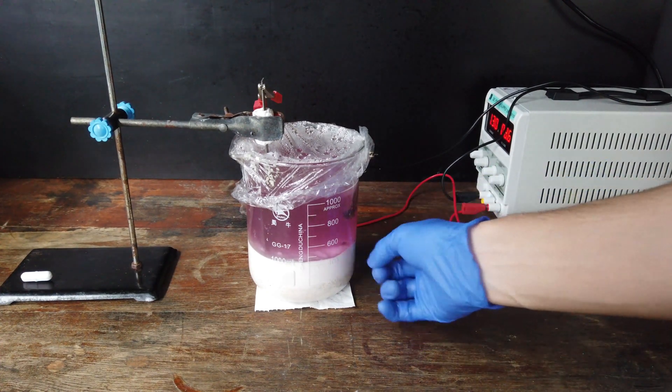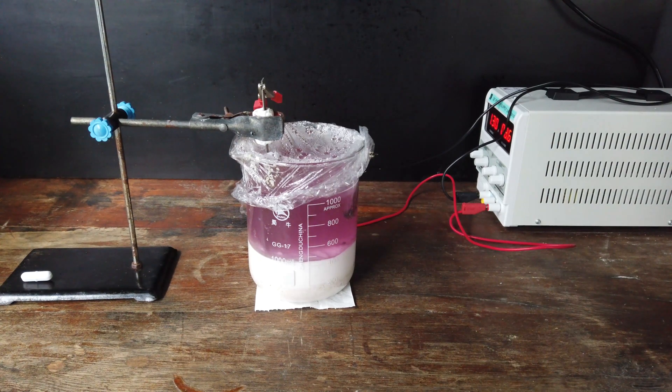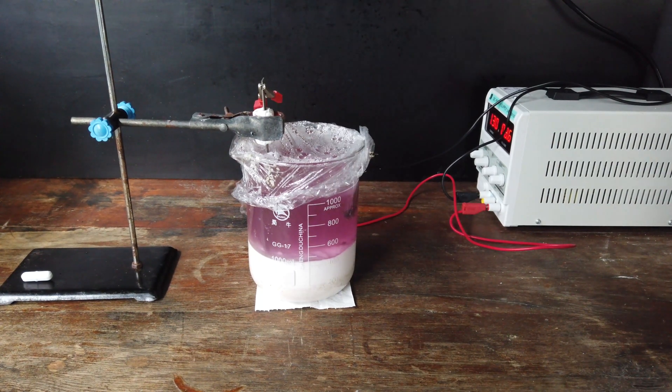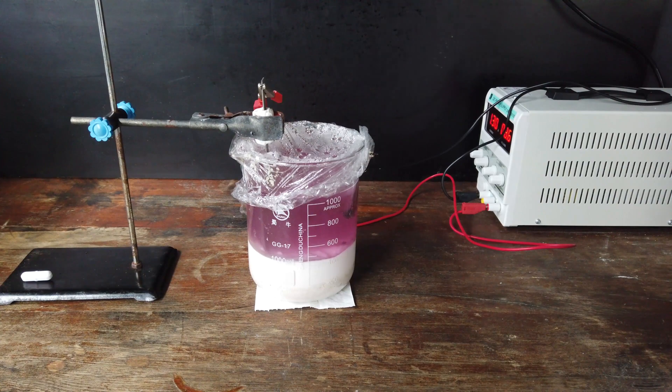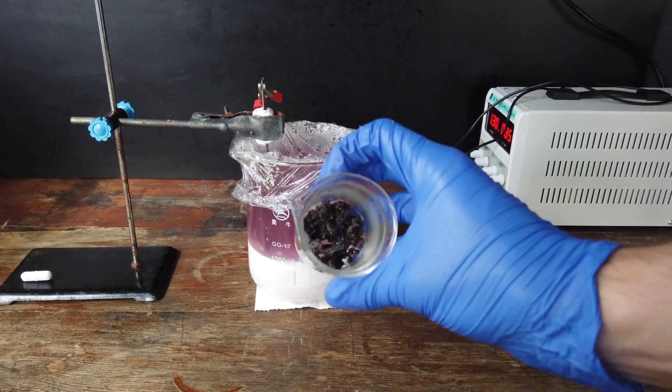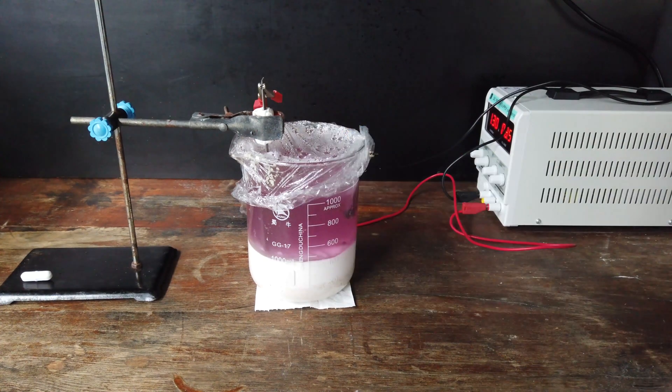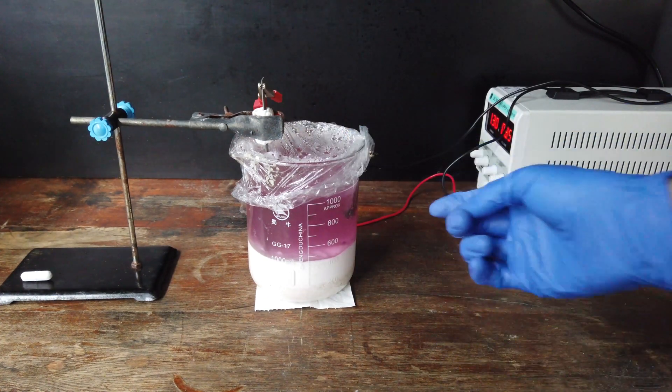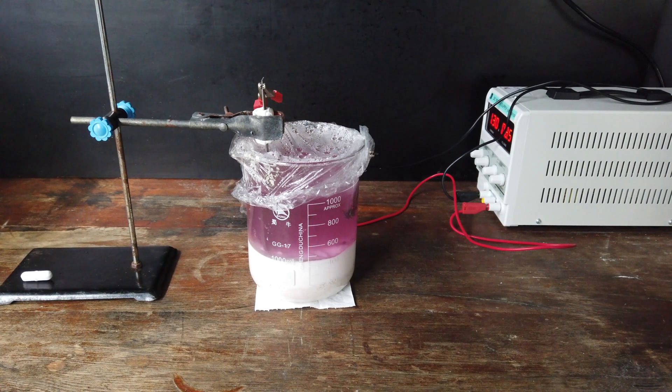And I've actually had to add a little bit more sulfuric acid a couple of times in order to make sure that we are actually dissolving our hydroxide precipitate at the bottom of the beaker. You will notice that after these two weeks of running the cell, we haven't generated all that much cobalt and nickel. It's a horrifically inefficient process, clearly, but it is working very, very slowly.